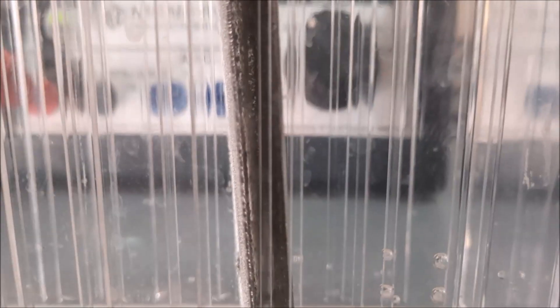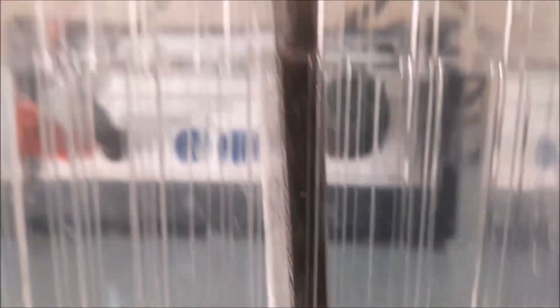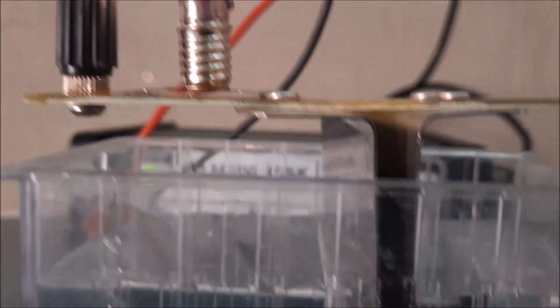And if we look closer, we can see that the negative side, this is the negative side. The negative side of the metal is forming a lot of bubbles. So those bubbles are hydrogen. So the negative side produces hydrogen, and the positive side produces chlorine gas.